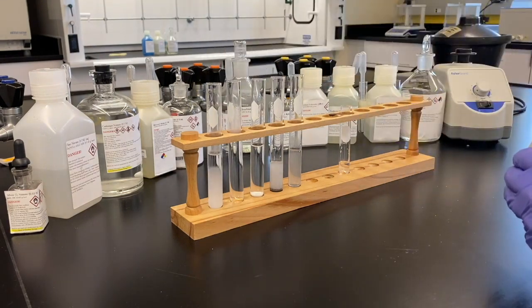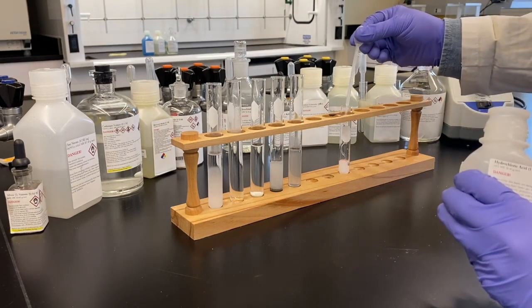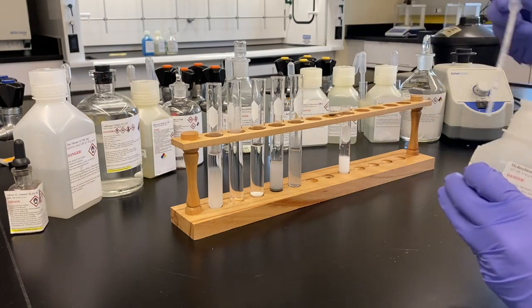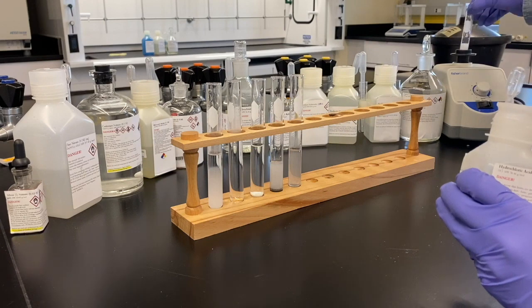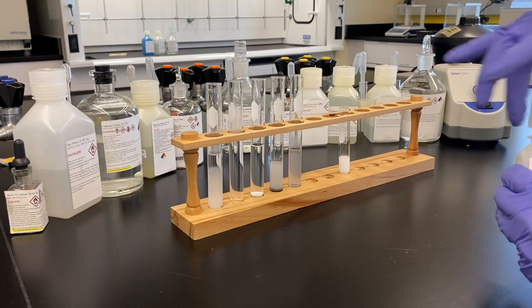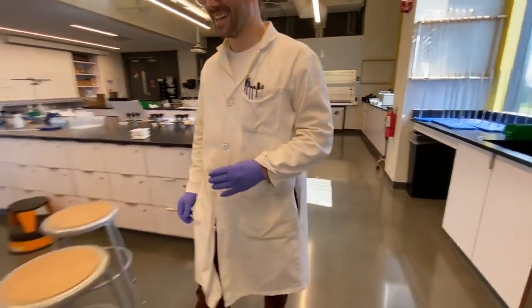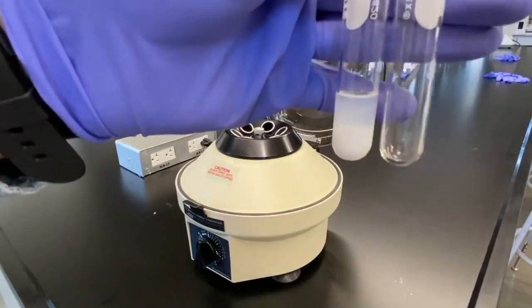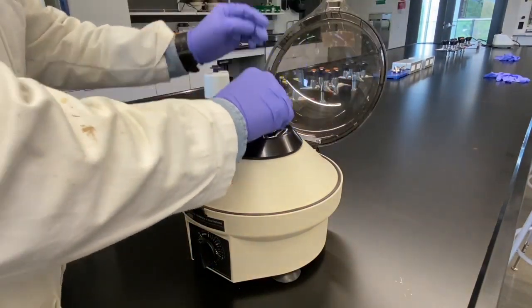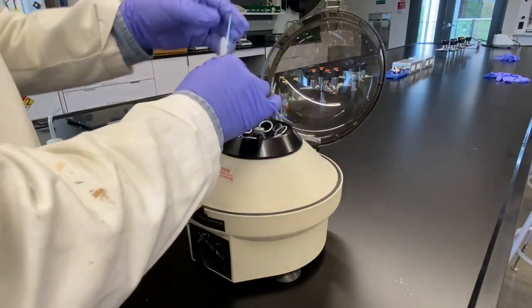So in our unknown, we're going to have several of these 5 cations that we've already looked at. We're going to have to find out which ones we have by reacting down this reaction tree and separating out each time precipitate from aqueous solution. So it makes a precipitate when you add HCl. Yeah. So we know we have either the silver or the mercury 1. We've got to centrifuge that off now, because we know that if we had zinc, cadmium, or mercury 2, they would not form a precipitate. They would be still aqueous, dissolved in solution. We have to separate then the aqueous part from the solid.